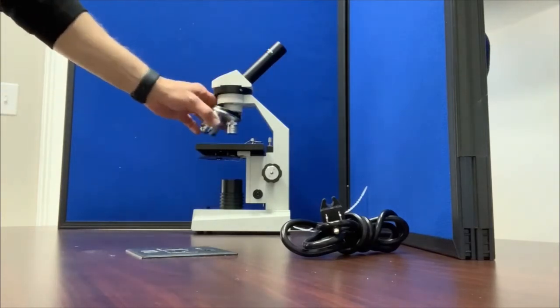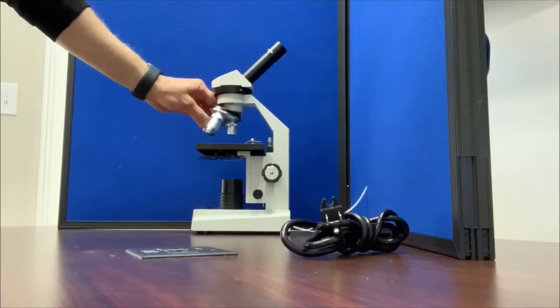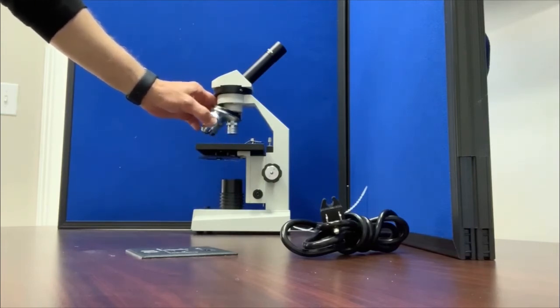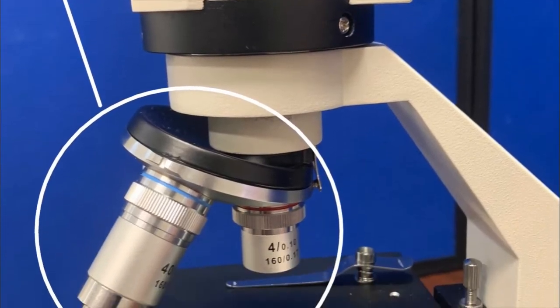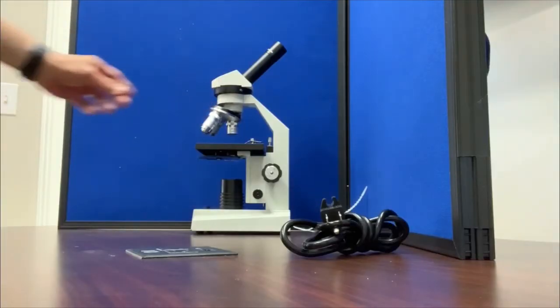This component of the microscope right here that I'm spinning is called the nosepiece. It will click into place when you select your objective lens. And yes, the objective lenses, these pieces right here, are mounted in the nosepiece. The objective lenses are color-coded.